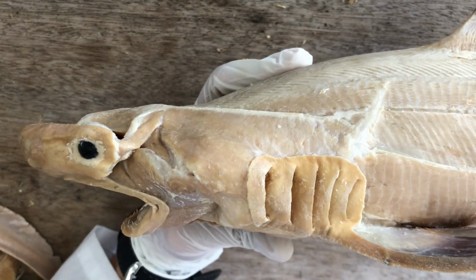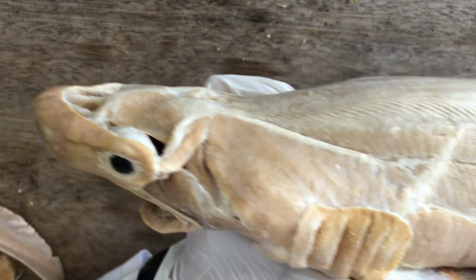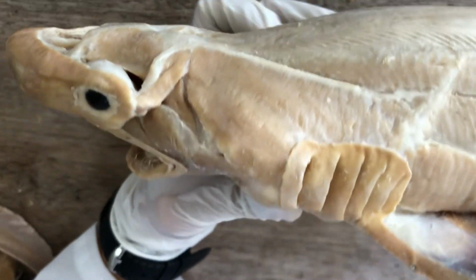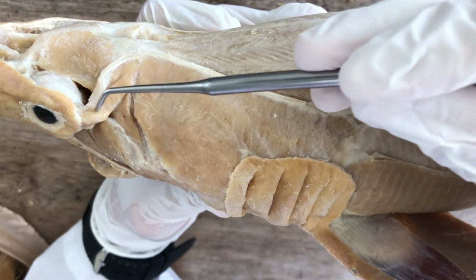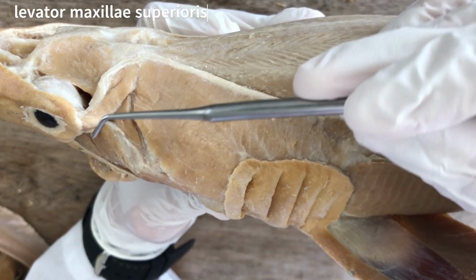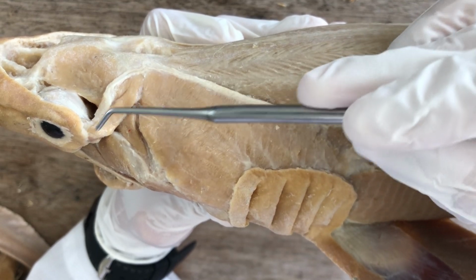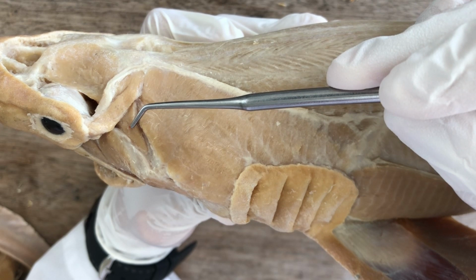Now we next go to the other category of muscle groups of the branchial muscles. This one is levator maxillae superioris, the levator muscle associated with the mandibular arch. It's different from this one.